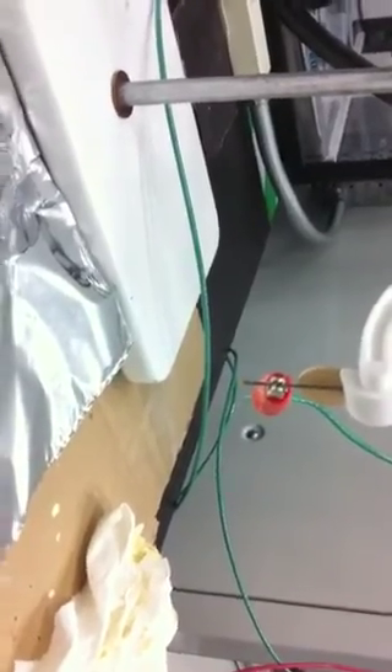Now as I am moving down, that is our grounding plate — that is where we now have electrospun nanofibers that I have been collecting on the grounding plate for some time, the length of this video which is currently at 4 minutes and 29 seconds. That is just a semi-quick demonstration of electrospinning — have a good one.